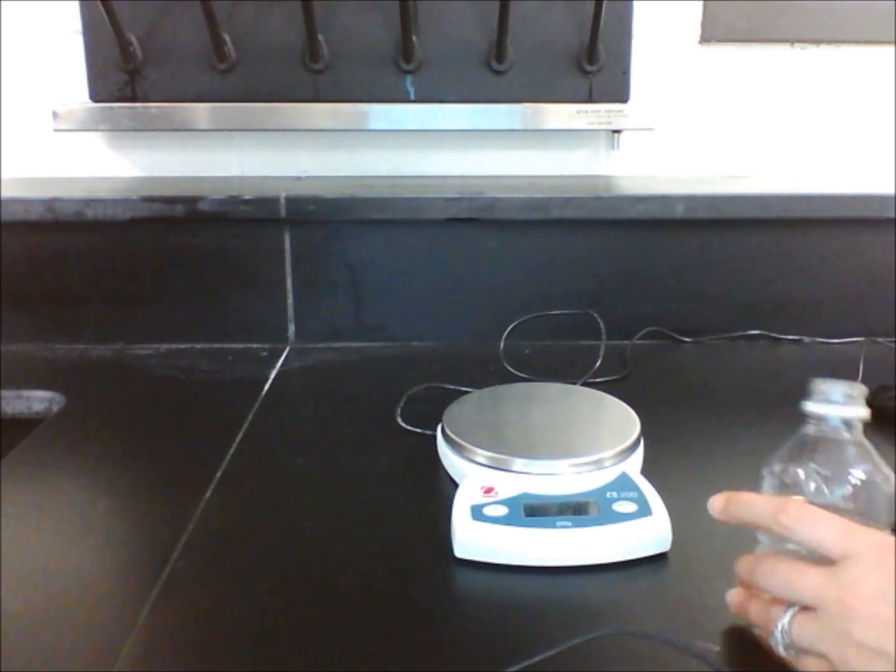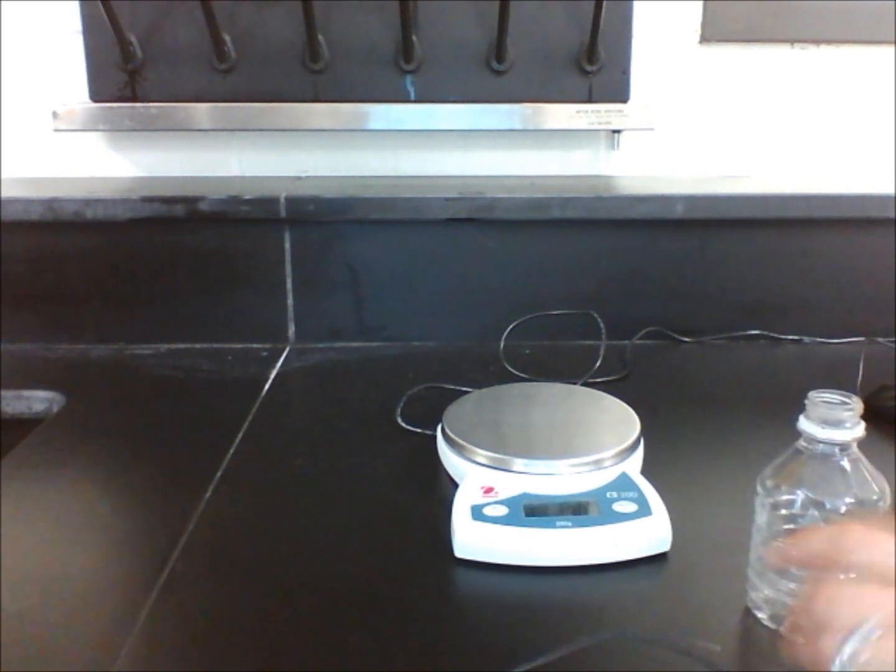Using a plastic water bottle with screw cap, paper towels, two crushed ice cubes, and access to an electronic balance, students will create a closed system where a solid will melt into a liquid.